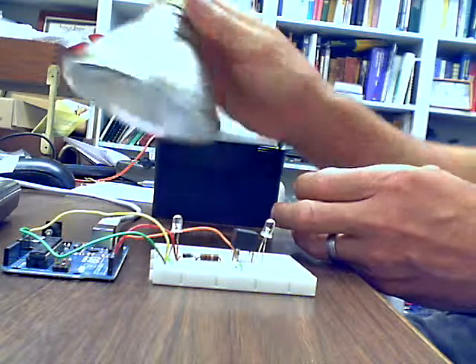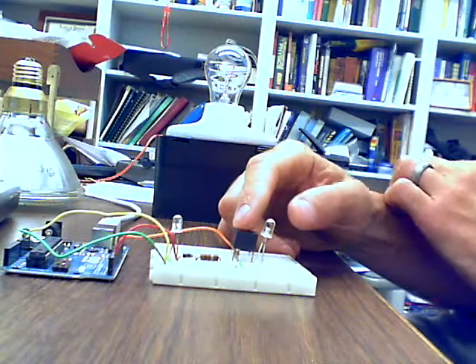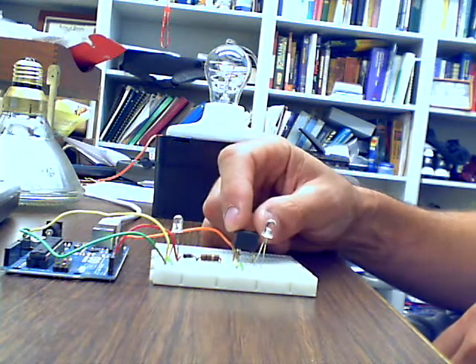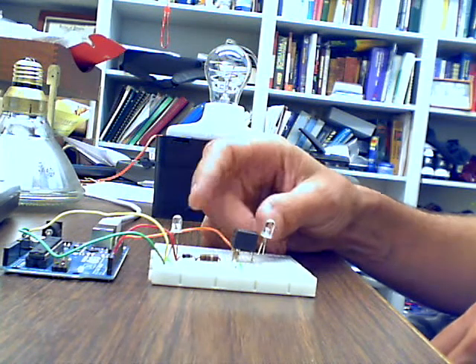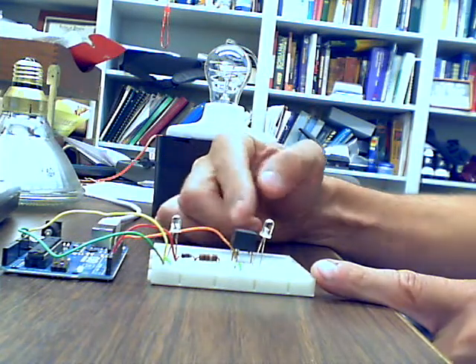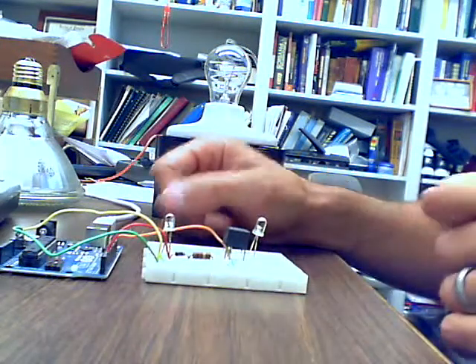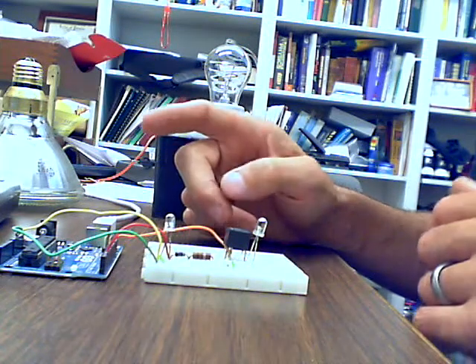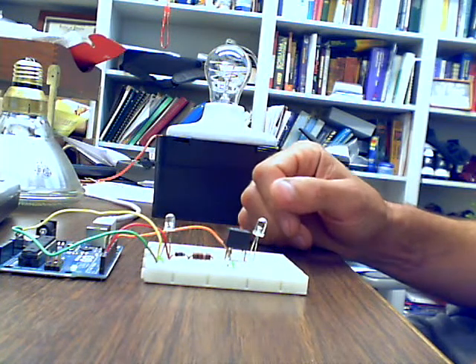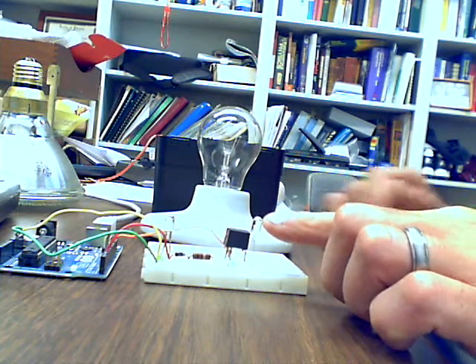It's a floodlight. One thing to be aware of is that the relay that we're using here, this G5V-1 by Omron, is really only rated for about 60 watts. So something to keep in mind, if you plug a 100-watt light bulb into it, it's possible that it could end up frying. You may want to replace it with a higher wattage relay or stick with something that's 60 watts or less for your flood lamp. Okay, so we're going to connect this instead of this.